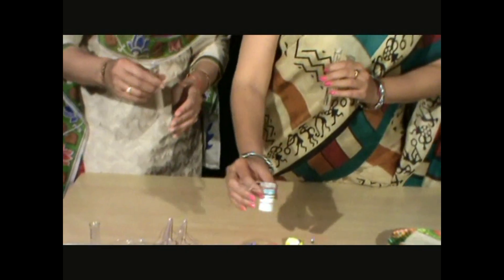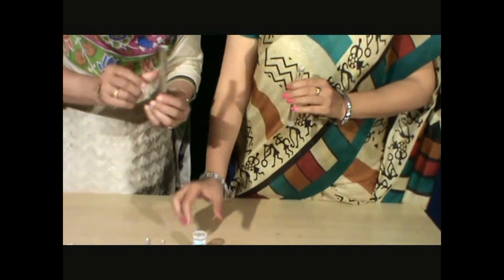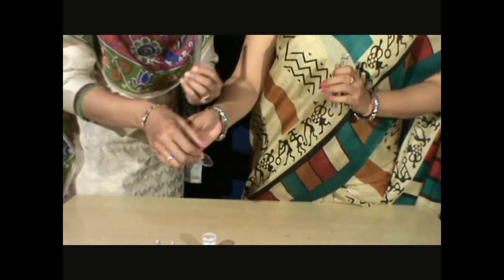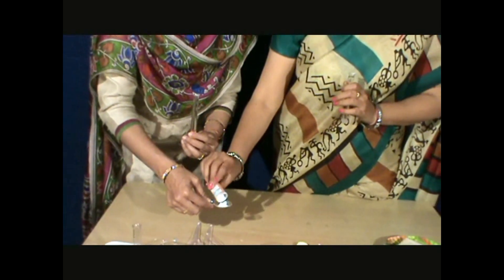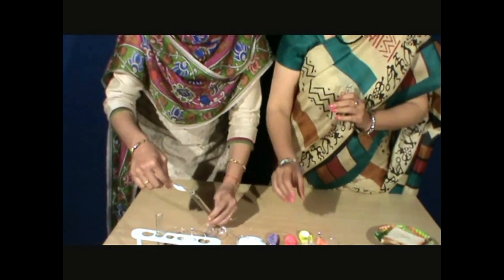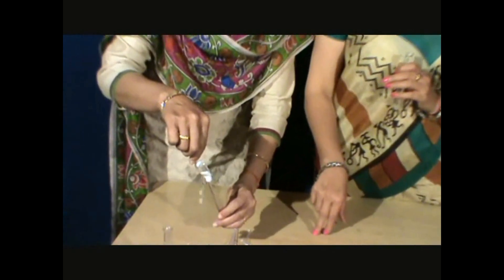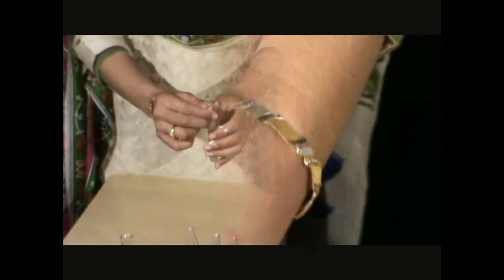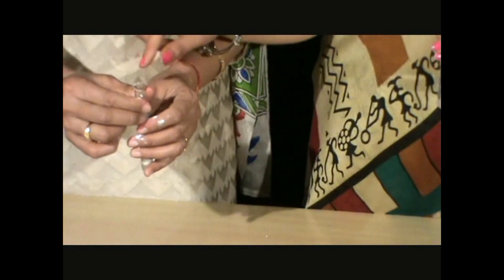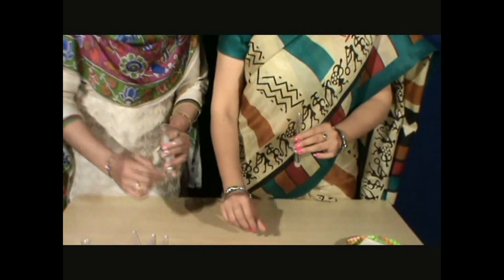Now we will add yeast powder, but only to one test tube. In test tube A we will add yeast; in test tube B we won't. Now we have added yeast in test tube A and there is no yeast in test tube B. Now we will add balloons on them.